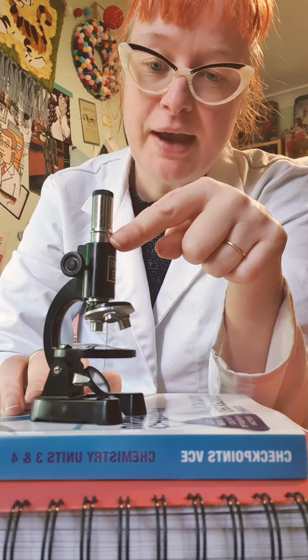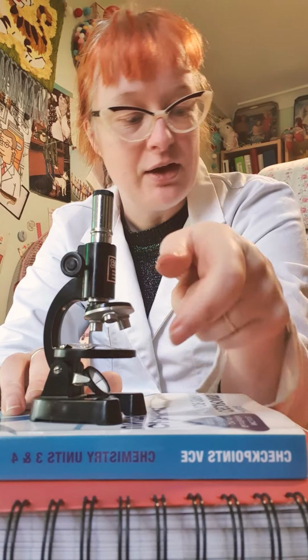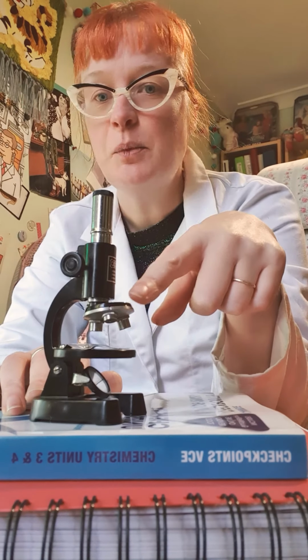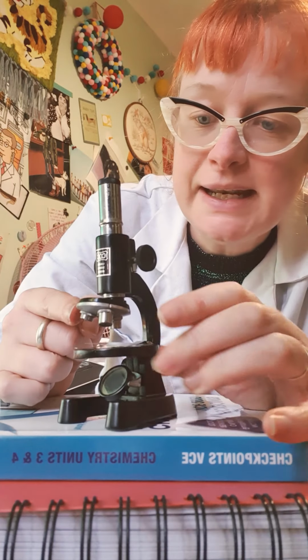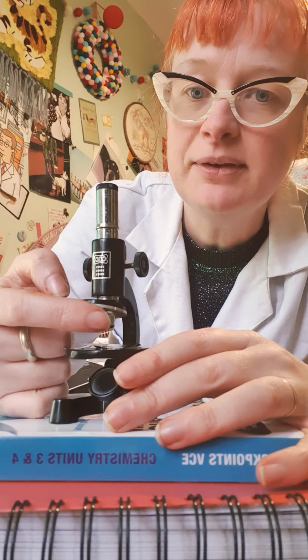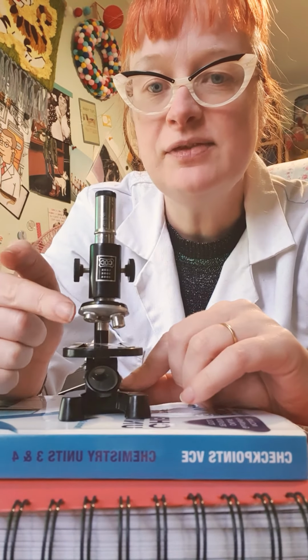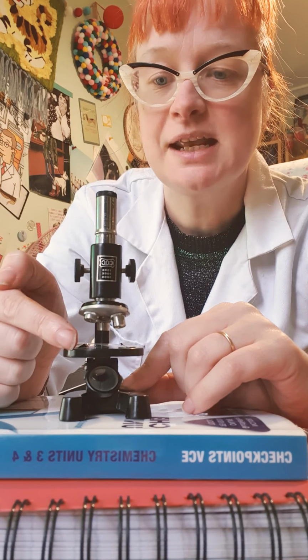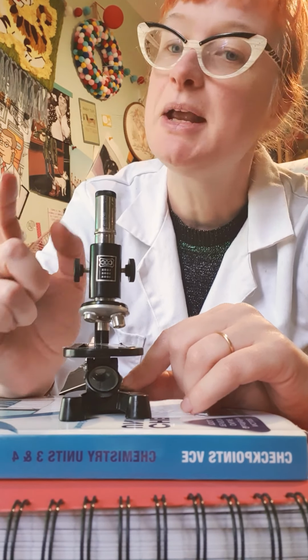Then the light travels down here, gets magnified by the lenses in here, and then we have little lenses down here on our, what are these called? Objective lenses. The objective lenses. So what we can do with these ones is you can spot maybe that they've got little different sizes. So they've got a small one, which is normally like 10 times, then a middle-sized one, and a larger one. These are different sizes, and then it multiplies. So if we've got 10 here and 10 here, then our object's going to be magnified 100 times, 10 times 10, 10 times 40, or 10 times 100. Depends on which one we use.